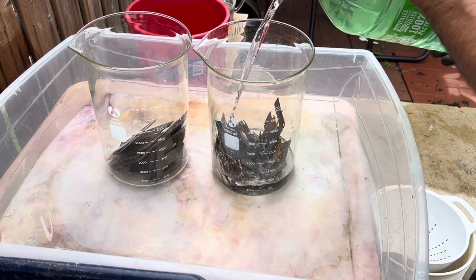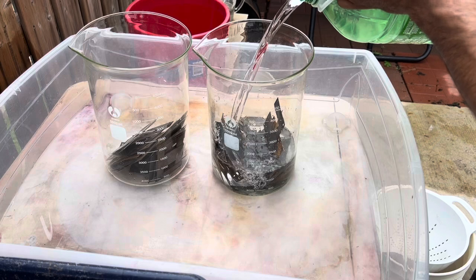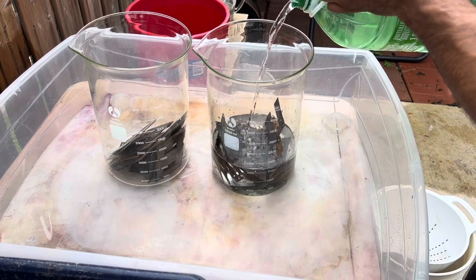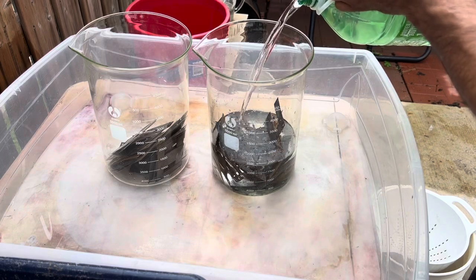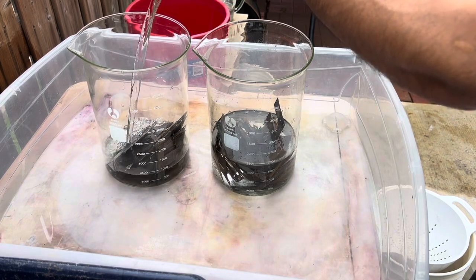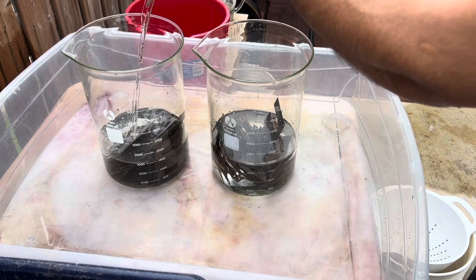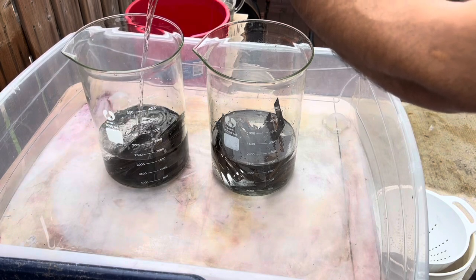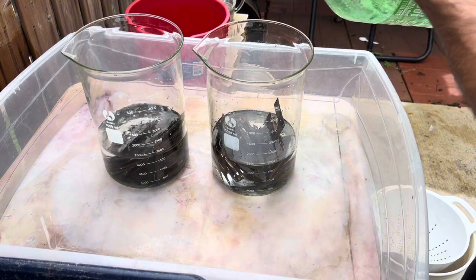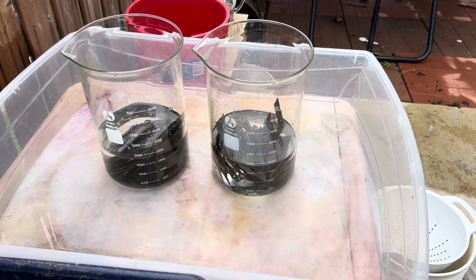What I'm doing here is putting water — I'm going to make about two liters — and then I'll add sulfuric acid. I'm trying to get a 10-to-1 dilute sulfuric acid solution. Let's see what happens.